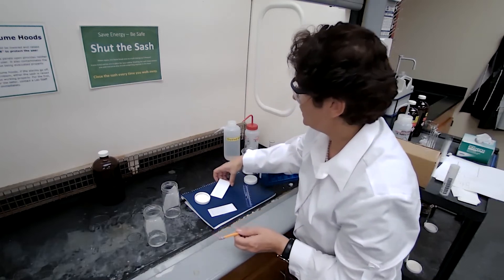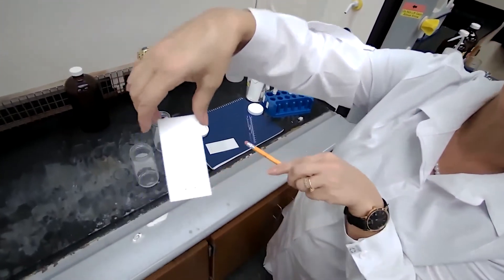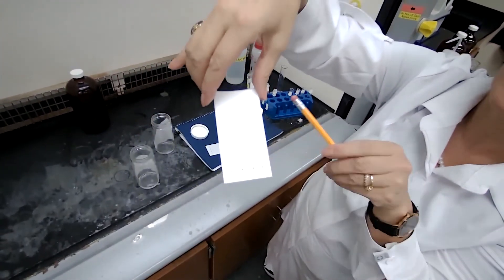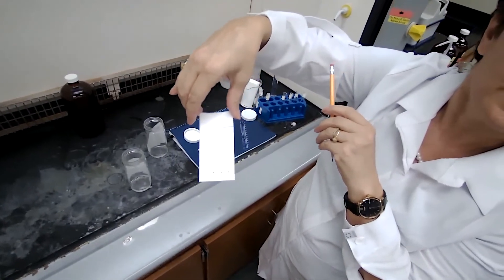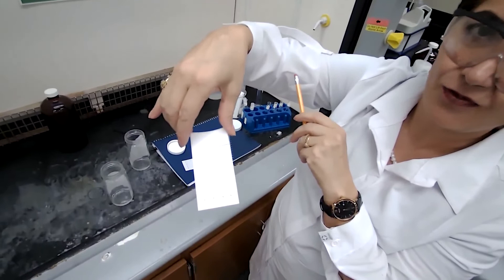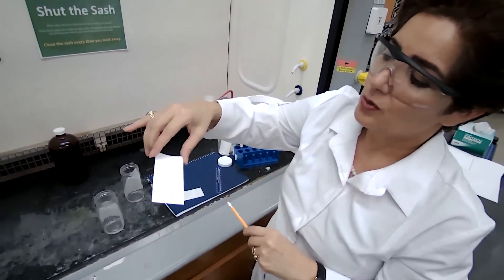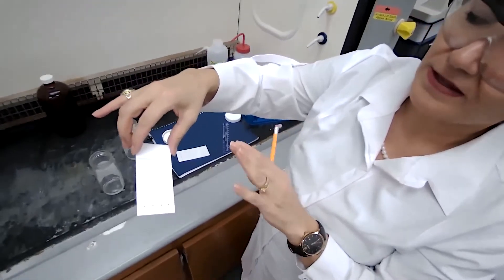Just want to show you this plate, how the line disappeared. If I didn't have the drawn line, you couldn't see where, how far the solvent has traveled.